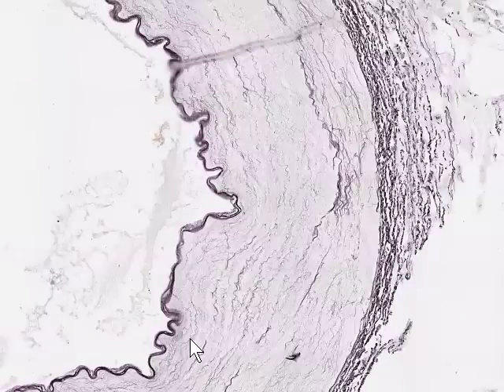Here we're looking at that muscular artery having been stained to demonstrate elastic fibers and elastic lamellae. The first thing which is apparent is the very, very dark staining of the endothelium and tunica intima, and in fact this is partially due to the endothelium and intima itself, but principally due to the thick internal elastic lamina which is present here, indicating that there's a very, very thin tunica intima just inside or internal to that. So the tunica media extends from here to here.